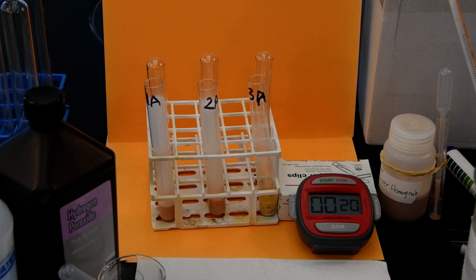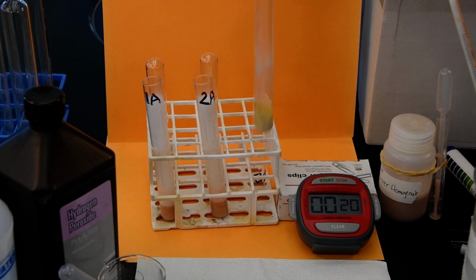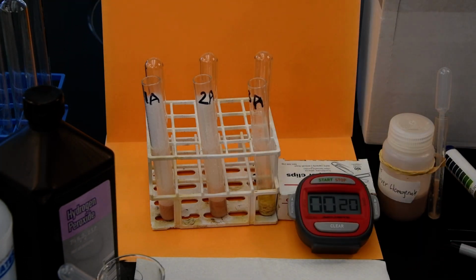So not much of a difference between the cold and the body temperature. Certainly a big difference if you've heated up the catalase. So we'll let it go at that, for you guys to think about this and draw some conclusions. But hopefully you're getting some understanding about the conditions in which enzyme activity is affected. Temperature is definitely a very important physical factor in determining how fast enzymes can get together. So they need to be warm enough, but not so warm that you would denature and alter the shape of the proteins or enzymes themselves.